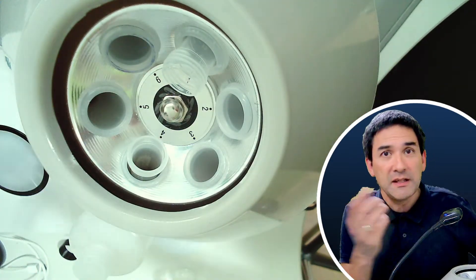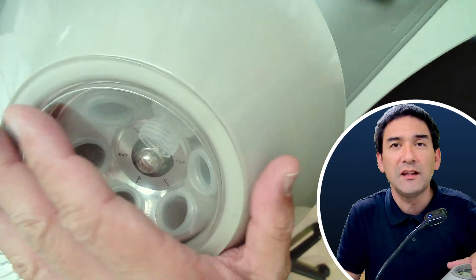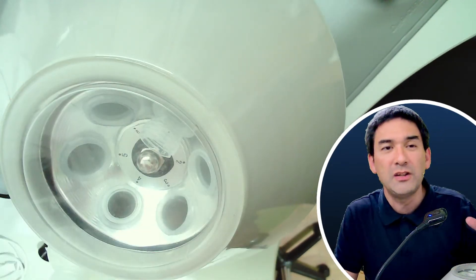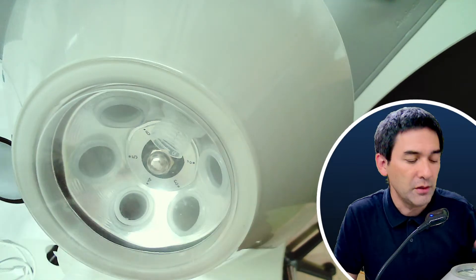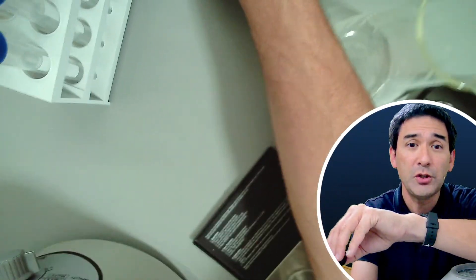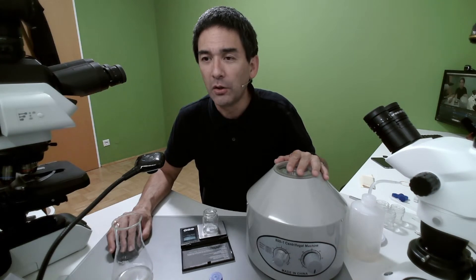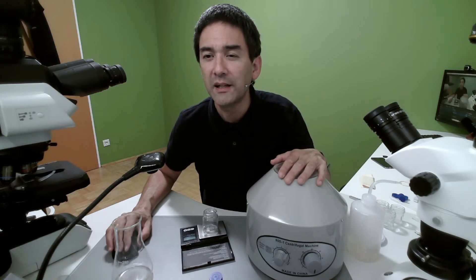That's basically what it's used for, and it will become clearer as soon as I use it. I'm not saying that if you want to do microscopy as a hobby you absolutely need one — it's certainly not required — but it can make life a little bit easier. A couple of months or years ago I decided to buy this machine to try it out, and I've made some other videos with it before. I'll also be interrupting myself to answer questions from the chat.